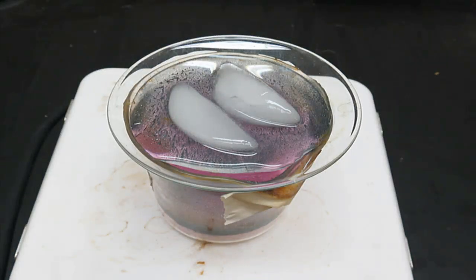Here's what it looks like from the top. You can see the ice, the watch glass, and then you can start to see that the crystals of iodine are forming underneath.